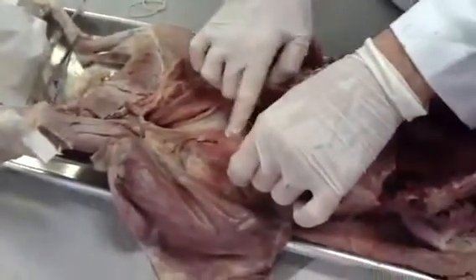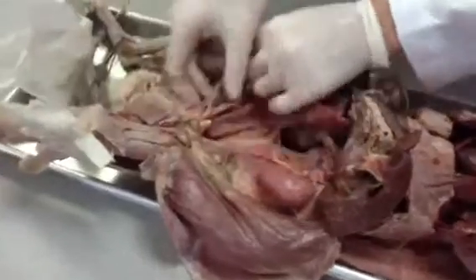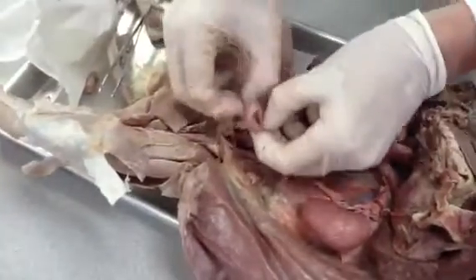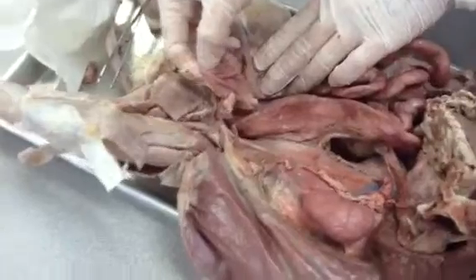And it would have the ureter here, and there's a ureter underneath here, going into the urinary bladder, which is right here, a large stretchy bag. This is the urinary bladder. It is set up to store and void urine.